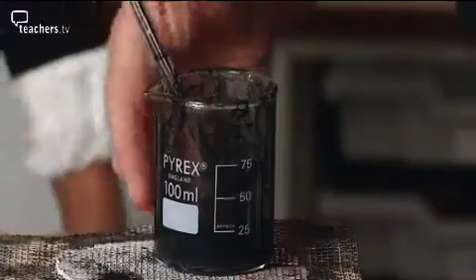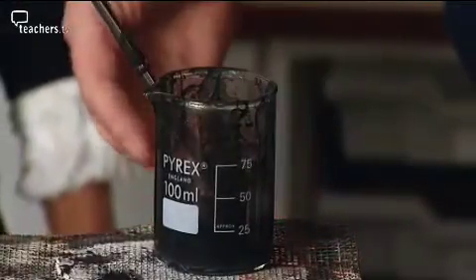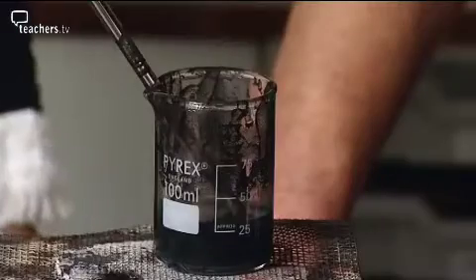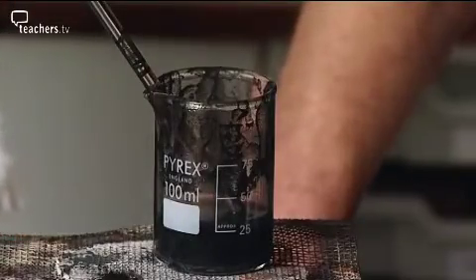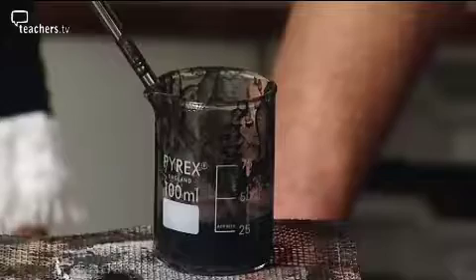As it cools down, you'll see that it's spitting quite violently at times, and it can actually spill all over the bench and all over your arms as well. So why is it spitting like that? Well, parts of the sulphuric acid, or it's not sulphuric acid now, it's copper sulphate solution, underneath the unreacted copper oxide is actually boiling and expanding into a gas, and it just shoots the whole lot out.